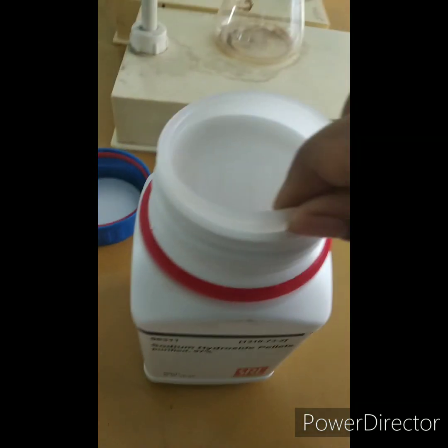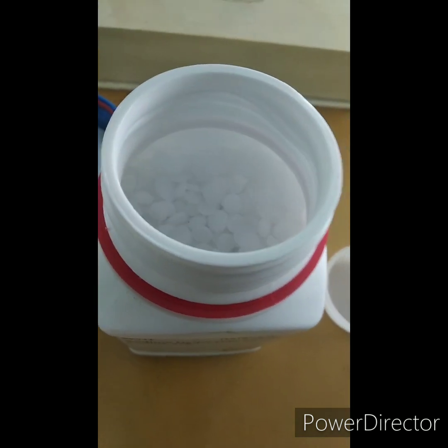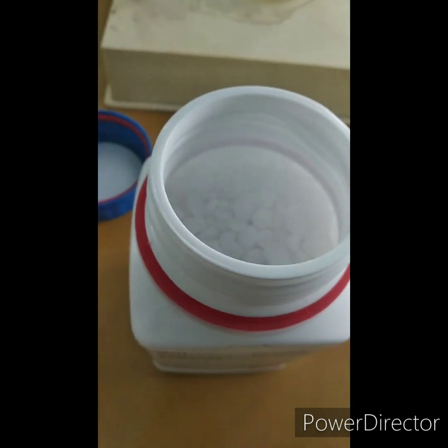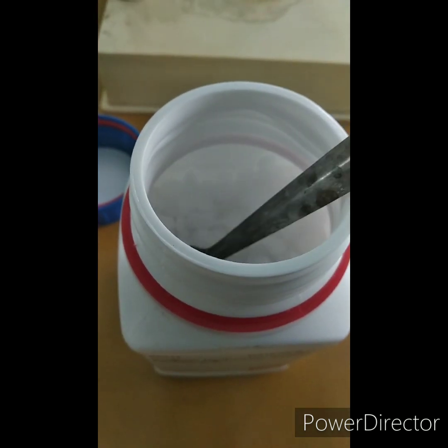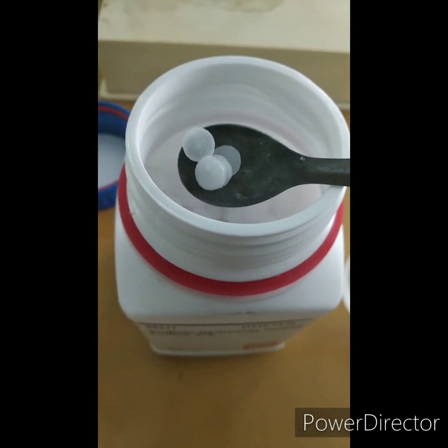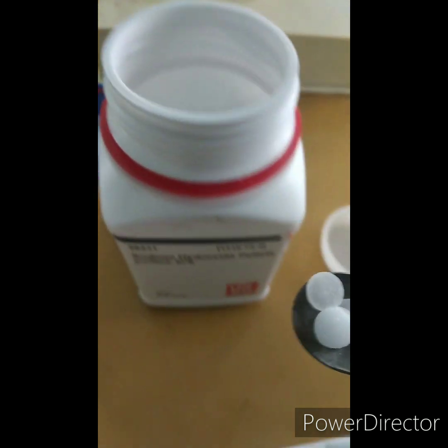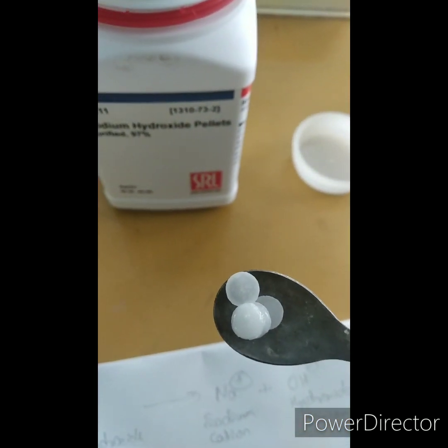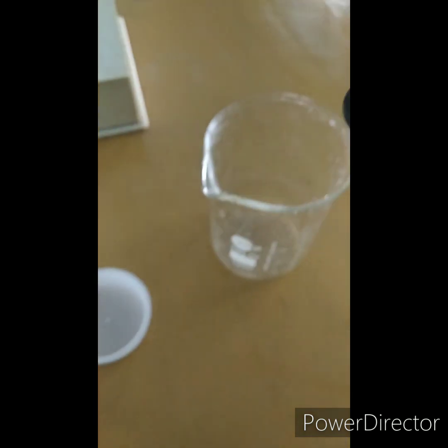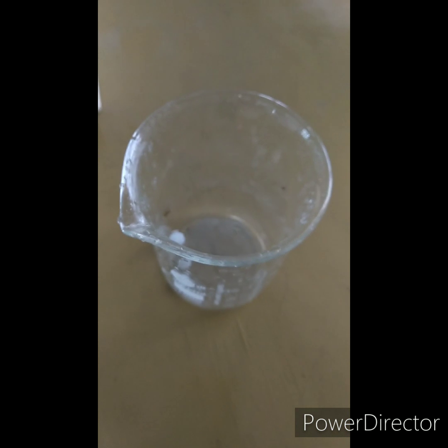Let's see how sodium hydroxide pellets look. It is actually in the form of pellets. Can you see? Sodium hydroxide is in pellet form. I'm taking a few of them.